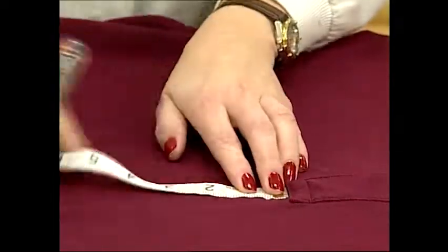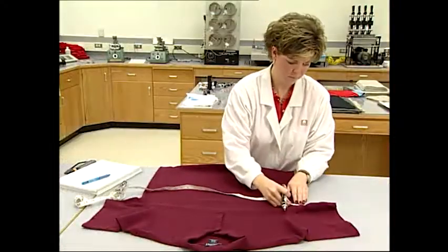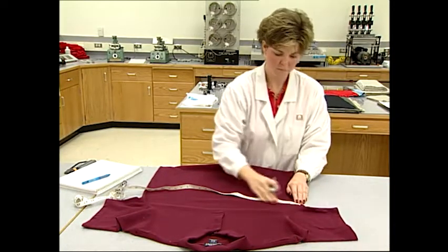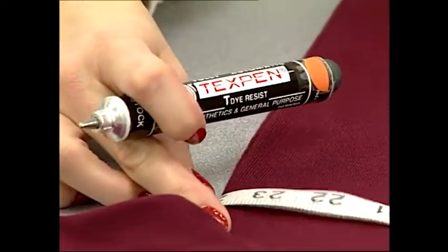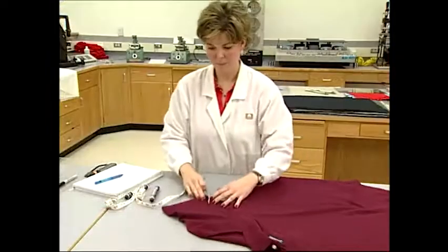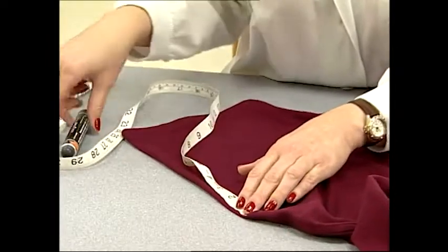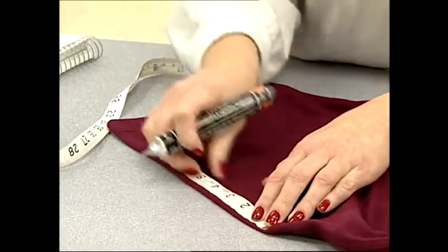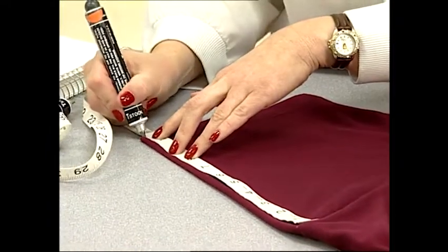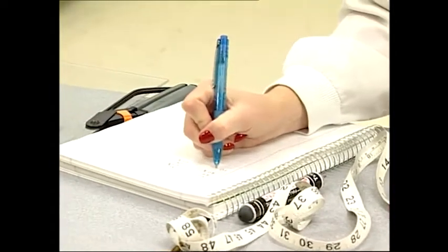Multiple and alternate positions may also be marked for the front and the back. The width is measured on the front of the garment just under the armholes, one inch below the point where the sleeves are sewn into the garment, from one side to the other to the tenth of an inch. The sleeves are also measured for length, starting at the top of the sleeve where it attaches into the shoulder assembly and moving down to the edge of the sleeve along the top edge. The width of the sleeve is measured across the bottom of the hemmed edge. Another commonly measured dimension is down the shoulder seam from the neck to the sleeve.